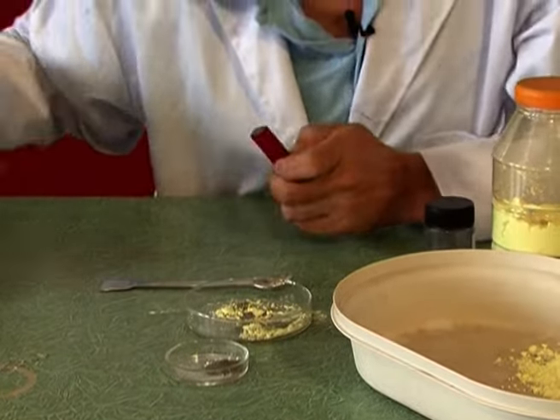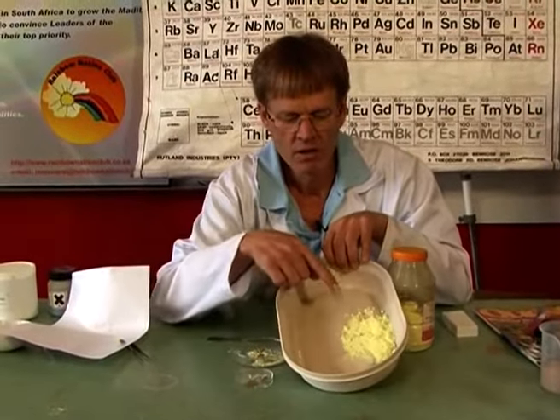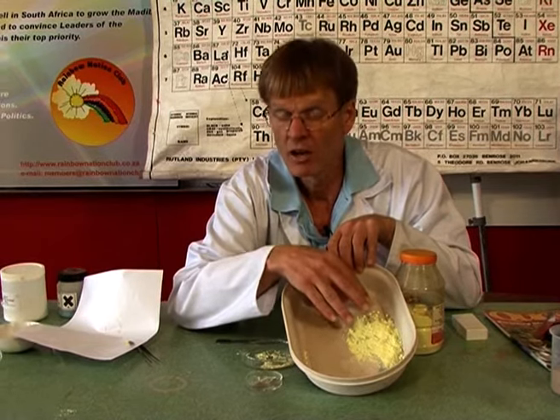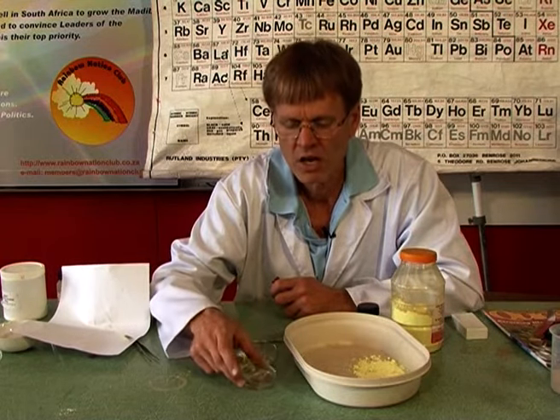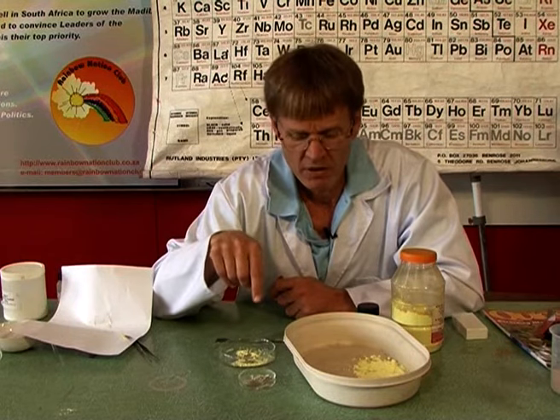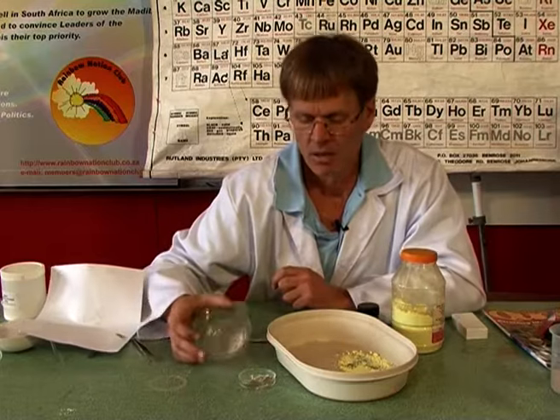And sometimes separation processes have to happen more than once. And you can see we started off with a messy grey mixture. And the sulfur is nearly completely alone there. There's a little bit of sulfur here, and by the second time, there's even less sulfur. And if I keep going through that process, I will eventually get pure substances. Just now in the lecture, we're going to take this very mixture, put them all together again. And this time I'm going to heat them, and we will make a compound which cannot be separated.